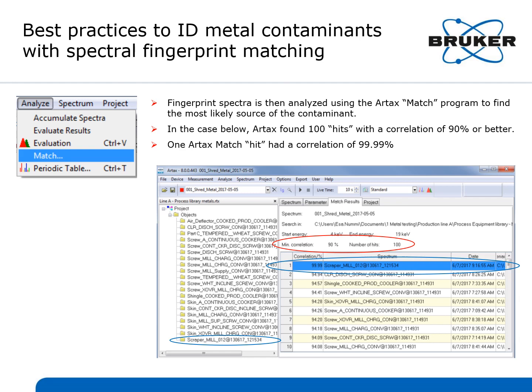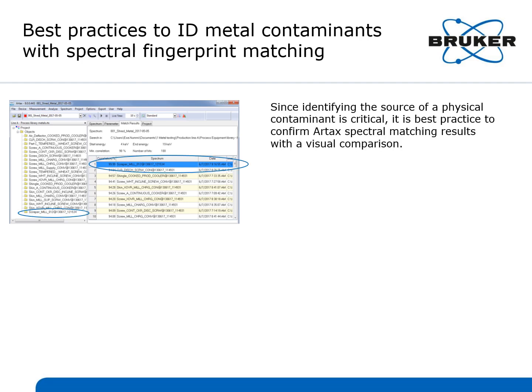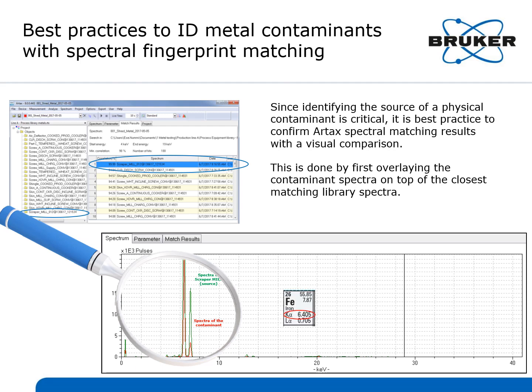That hit is highlighted in blue, and you can see it is identified as Scraper Mill 012 at 130617_121534. Let's take a closer look at this match. Since identifying the source of a physical contaminant is critical, it is best practice to confirm Artax spectral matching results with a visual comparison. This is done by first overlaying the contaminant spectra on top of the closest matching library spectra. In this case, it's the one that is 99.9% matched, the Scraper Mill piece. Let's zoom in on the spectra from around 6 to 7 keV, which is where the iron K-alpha and K-beta energy signals are.